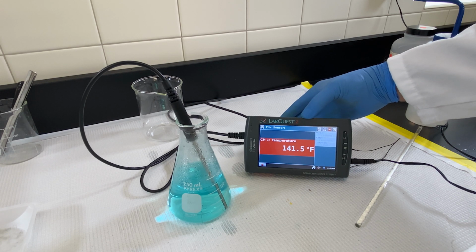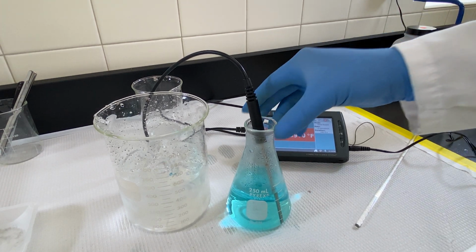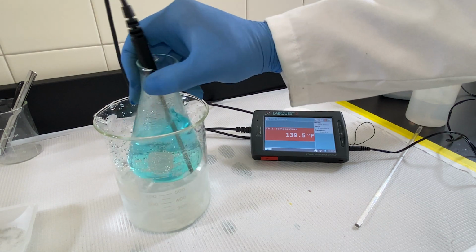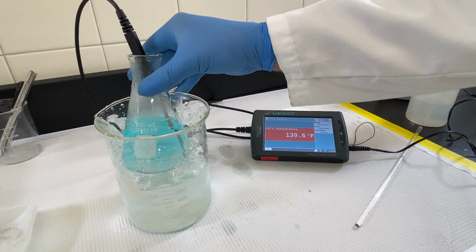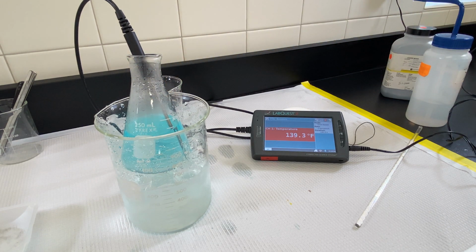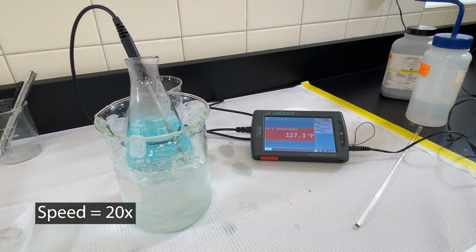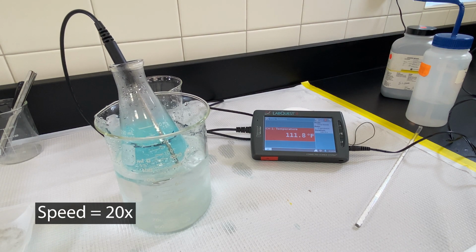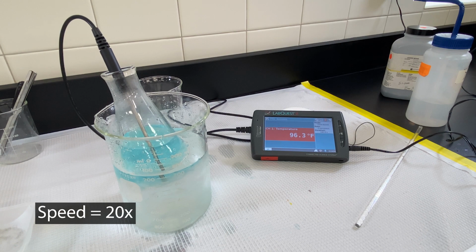The water is still very warm, and so we need to cool it down. The ideal being there are some components which are soluble in warm water, but they're not soluble in cool water. This experiment works because of our solution that's left, the two solutes, only one of them is soluble in cold water. The other one, although soluble in warm water, is not going to be soluble once it's cooled down.